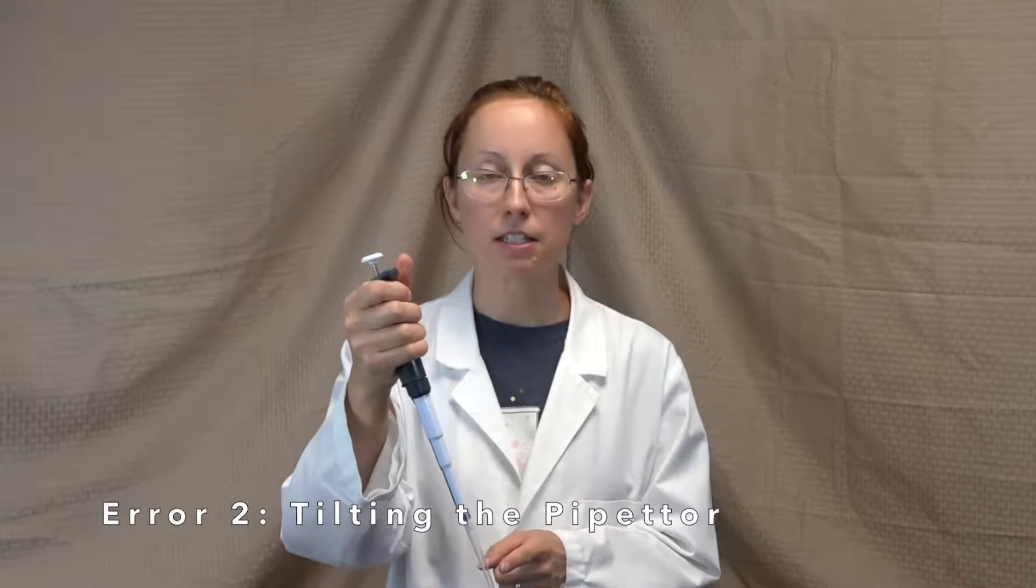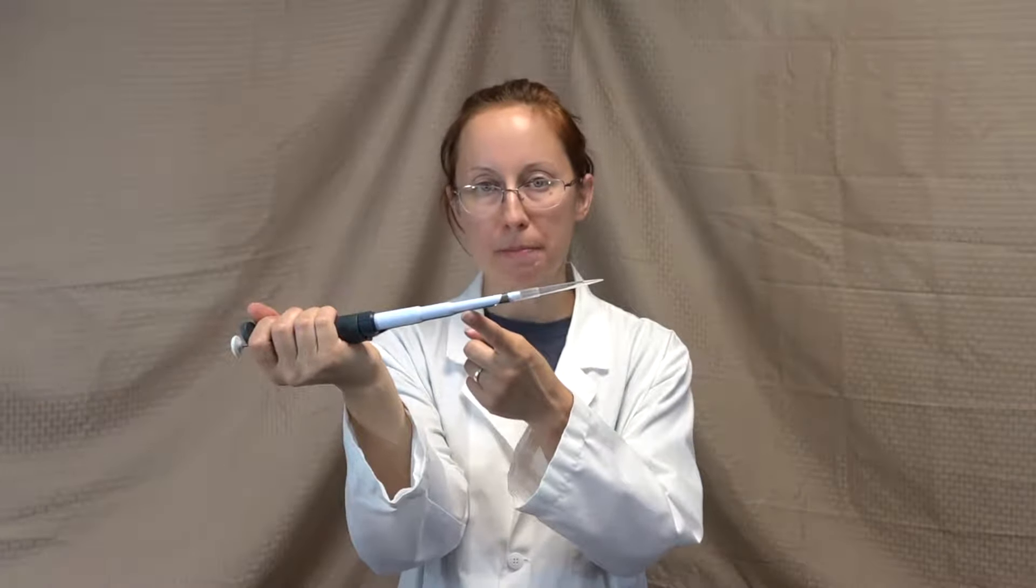Next, always keep the pipette tip pointed down. If you tilt it up, liquid could run into the pipette, damaging it or causing contamination.